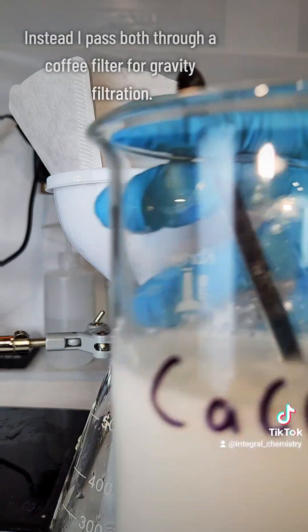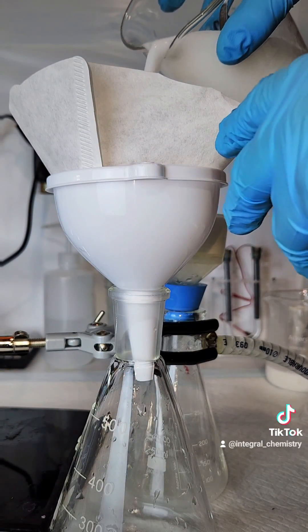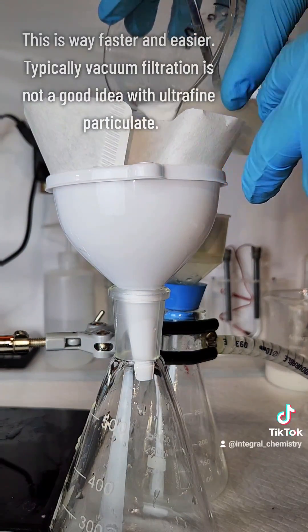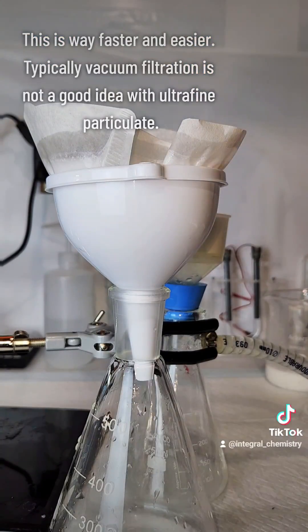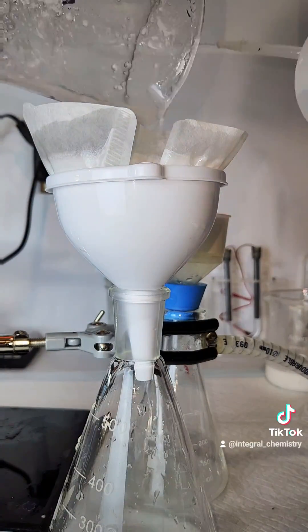So I opted for gravity filtration through a coffee filter instead. This method of filtration is way faster and easier, and typically vacuum filtration is not a good idea with ultrafine particulate.